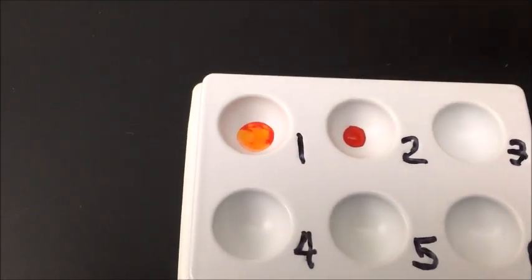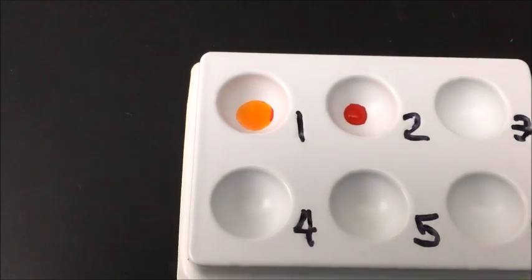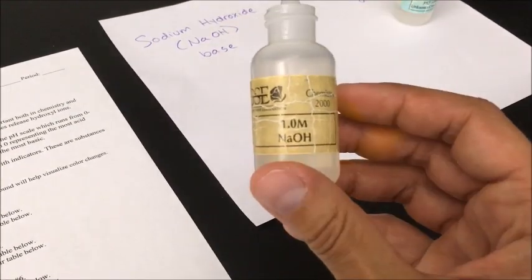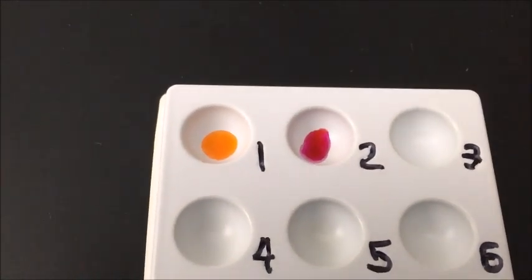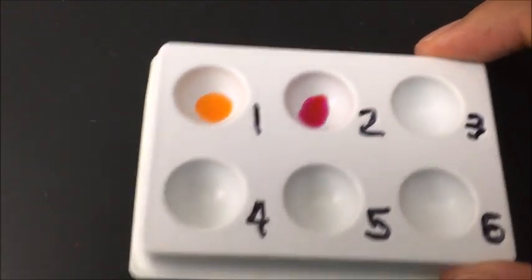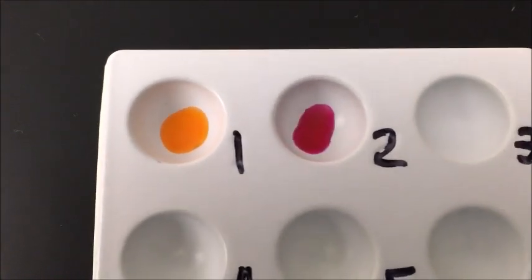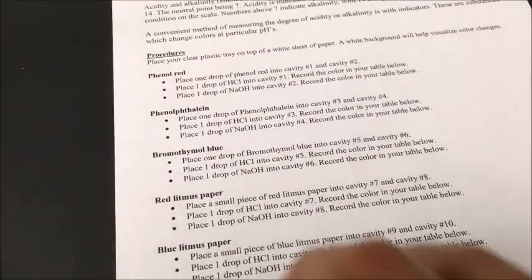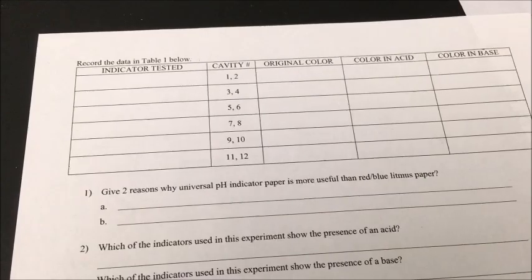Notice how it went from a reddish color to almost an orangish color — there's a color change, which should indicate something. Next I'm going to take my sodium hydroxide, which is a base, and add a drop into cavity number two. If I swirl it a little bit, it's gone from red to almost a magenta color. So there's a color change in both cavity one and cavity two. Now I'll fill in the observations on my handout.